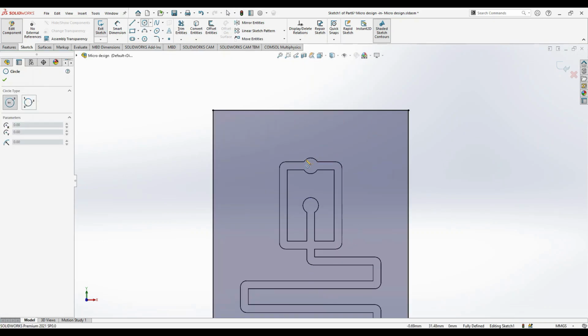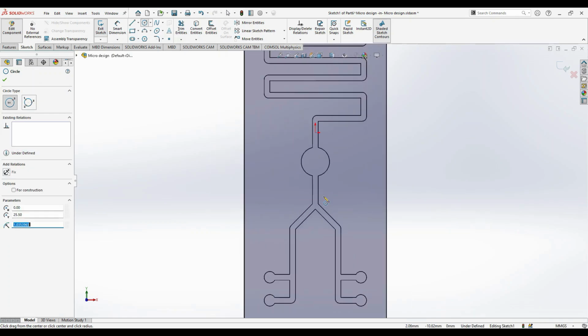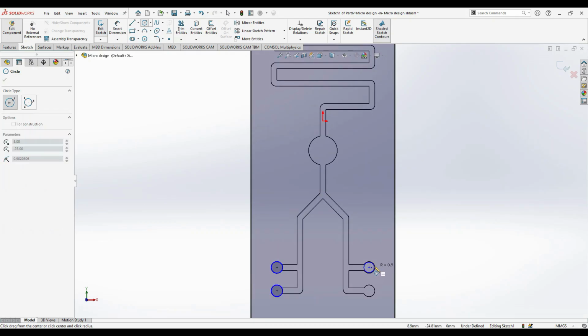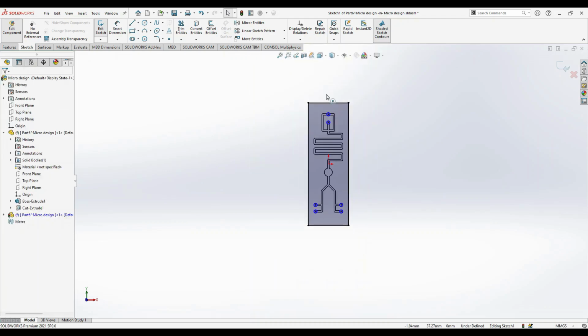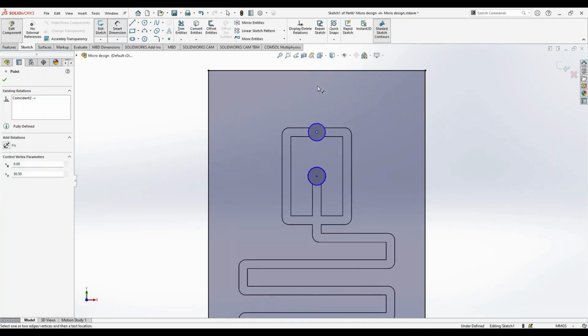So let's draw the inlets. One inlet, second inlet. Okay, the reservoir should be inside the channel, so we are not drawing on it. Third inlet. So these are the outlets. Now you can try to constrain them.